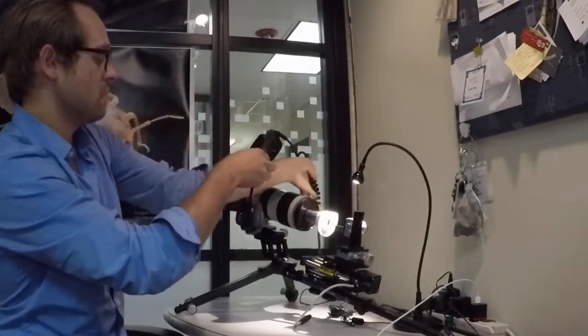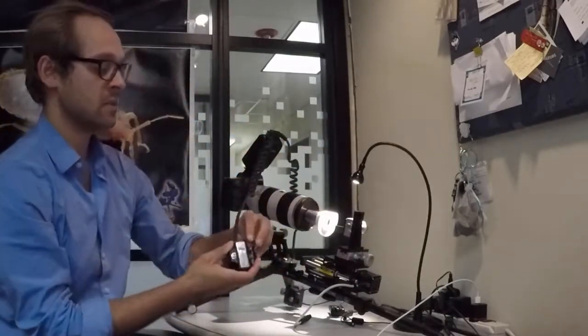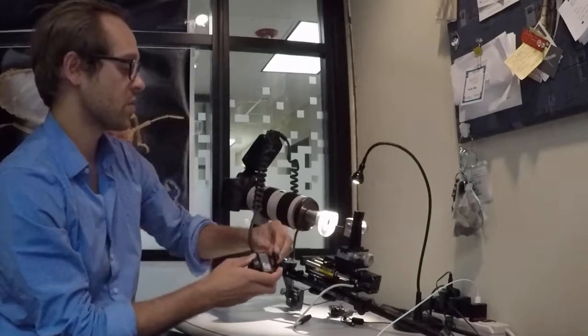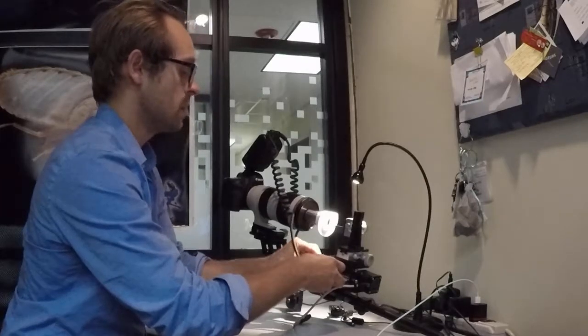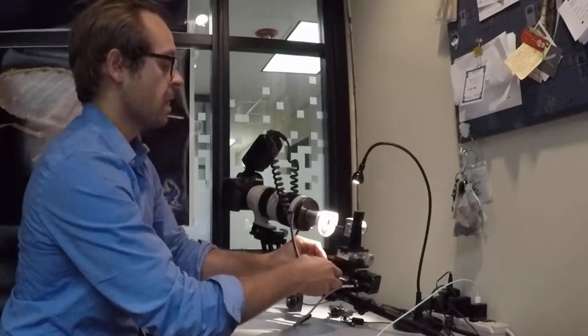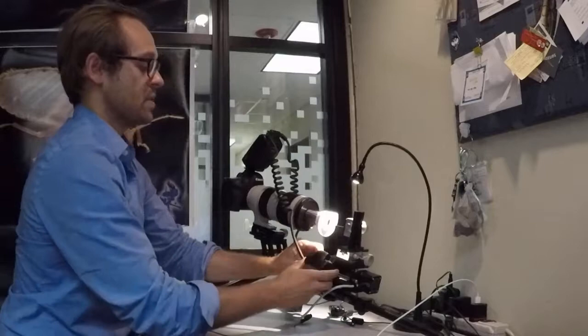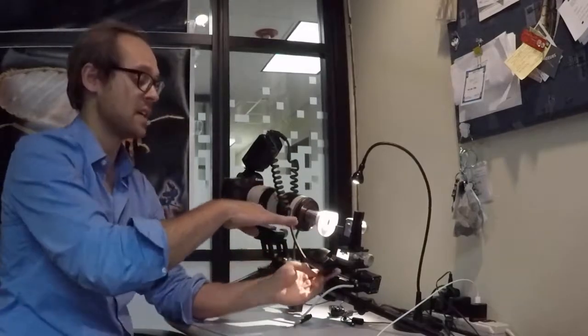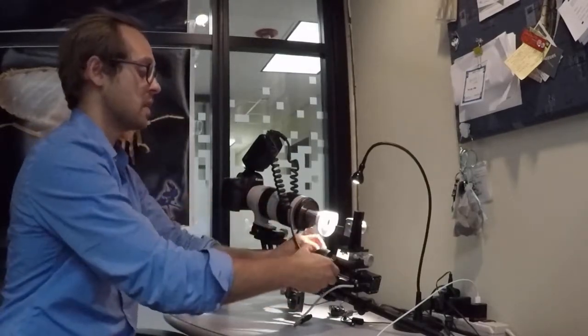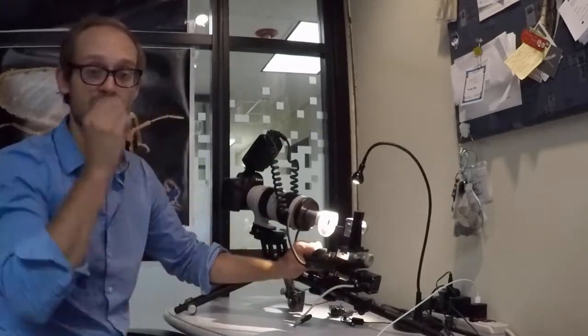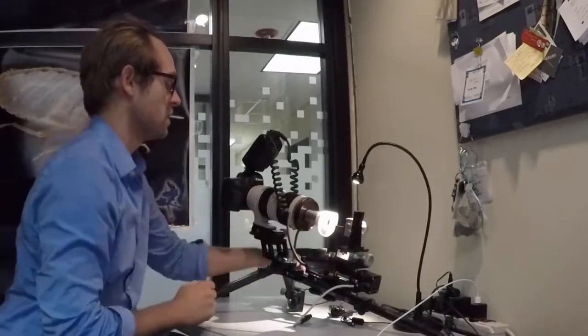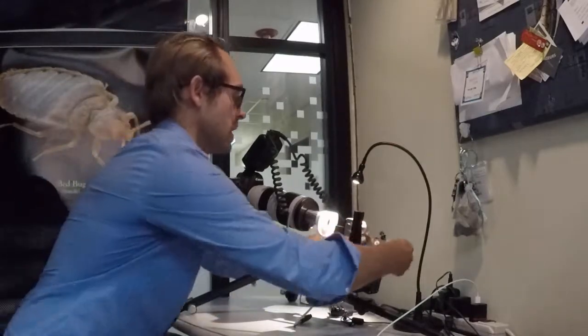Take each flash head, put it to its corresponding side, take out the screw to adapt the flash head and mount it directly onto your stage. So for this I always position them so that they're down instead of being completely horizontal. They're down about 30 degrees and then I turn the head so that they face towards the flat frontal surface of the white diffusers.